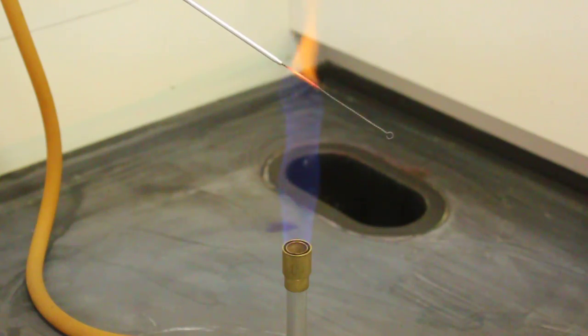Now that I have the bright orange color forming, I'm going to continue moving down towards the end of my inoculating loop. I want to make sure that the loop portion is the last part to turn bright orange.